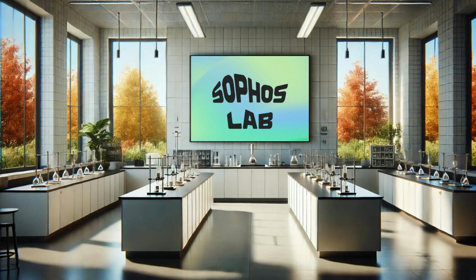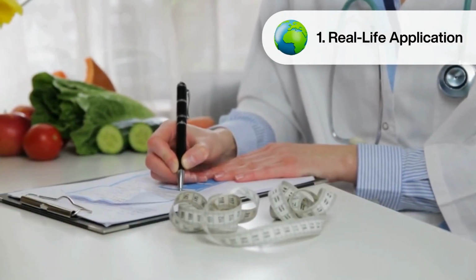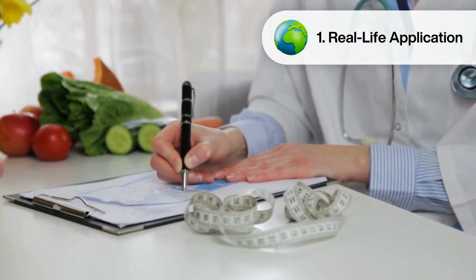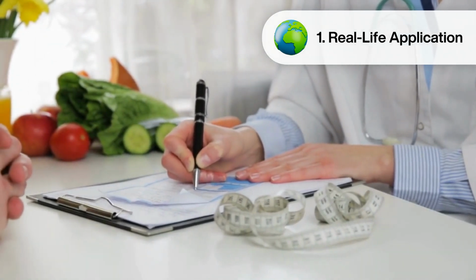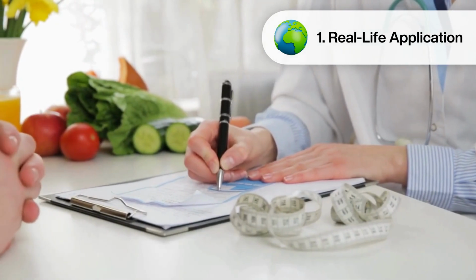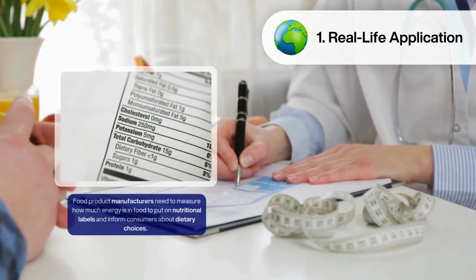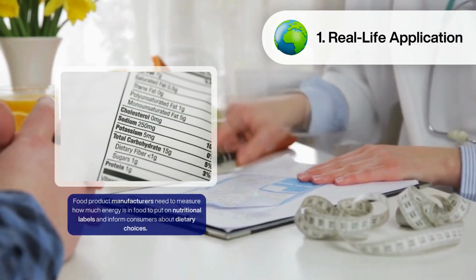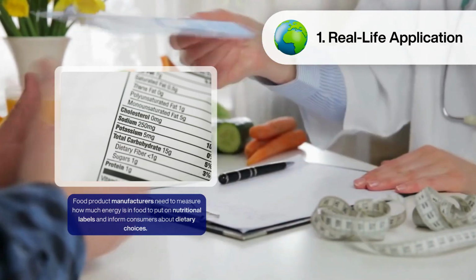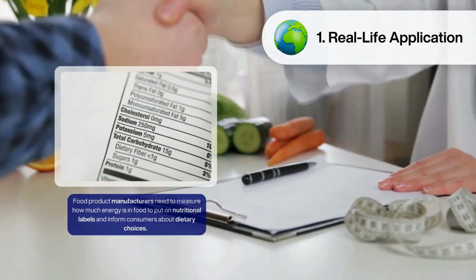Before outlining the practical, let's take a moment to consider its importance. Firstly, understanding how to measure the energy content of food has direct implications for your daily life. Every day you consume food to fuel your body, but have you ever wondered just how much energy different foods provide? Food product manufacturers need this knowledge to measure how much energy is in food to put on nutritional labels. These labels enable you to make more informed dietary choices, helping you understand how the energy from the food you consume translates into physical activity and overall health.